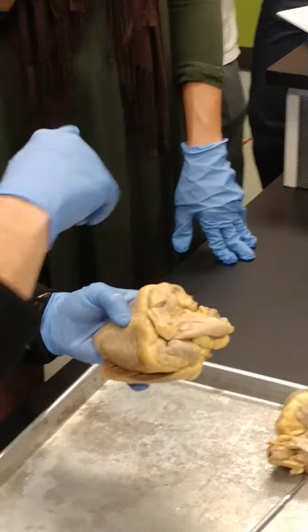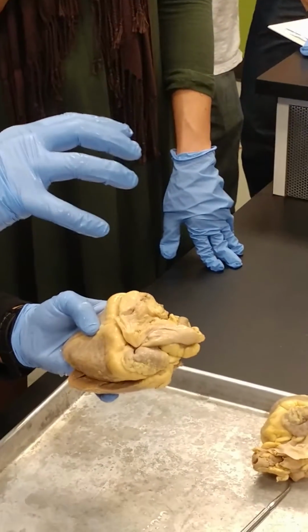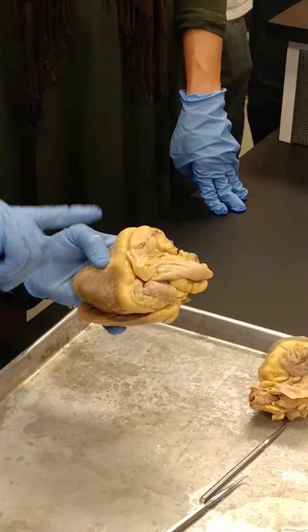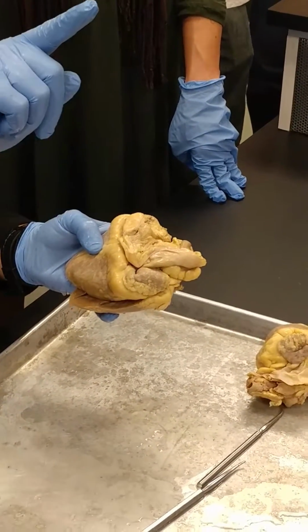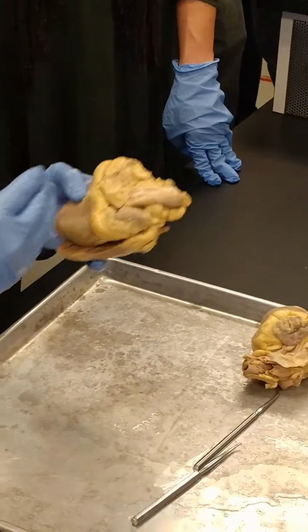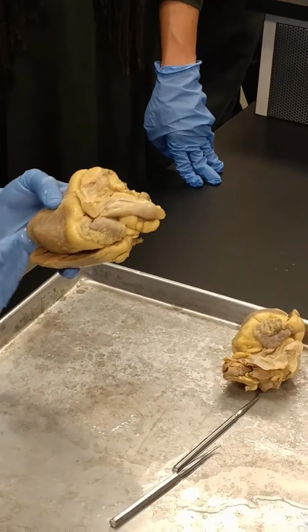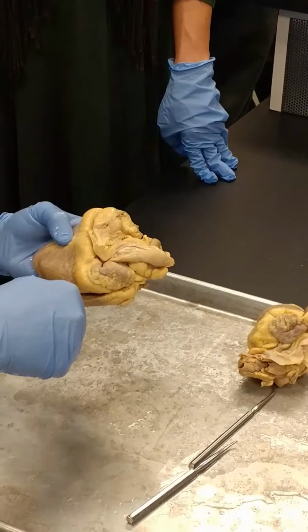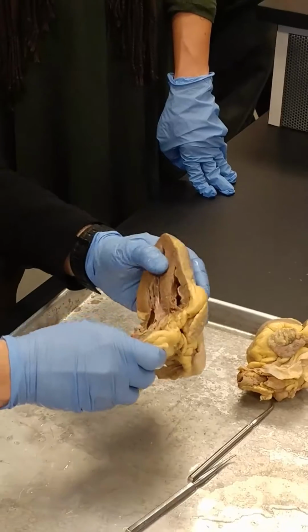Well, where does the main blood from my picture over there come from the rest of the body? It comes from the upper part of the body into the right atrium, the superior vena cava. It comes from the lower part of the body, the inferior vena cava, into the right atrium. So that's all unoxygenated blood going back to the right atrium, right? So it makes sense that the unoxygenated blood from the heart goes back to the right atrium as well, correct? So that's called the coronary sinus.